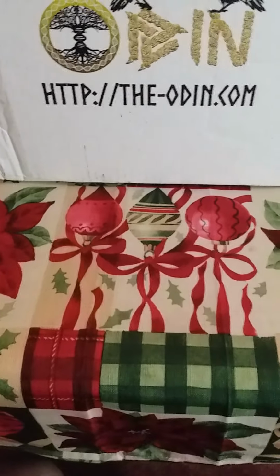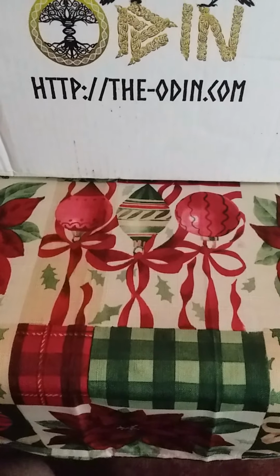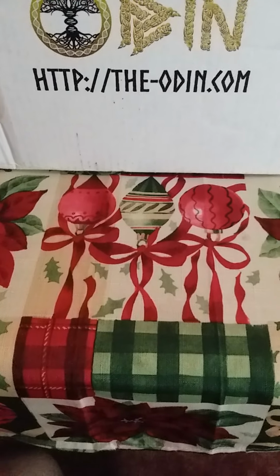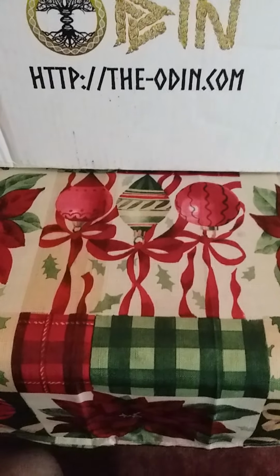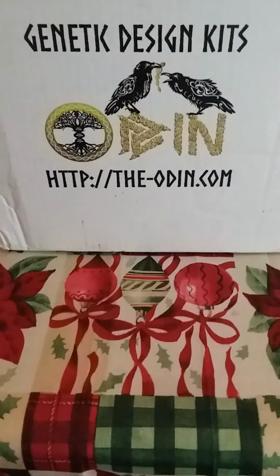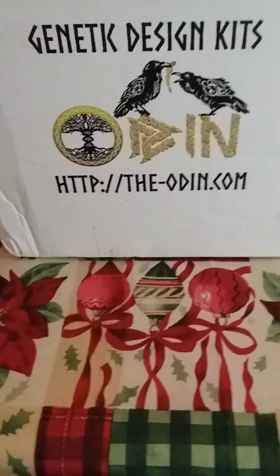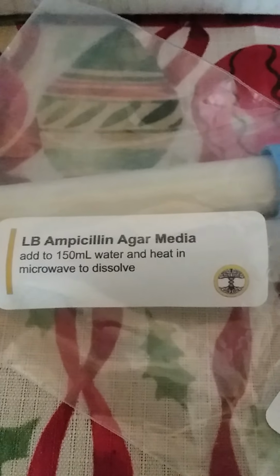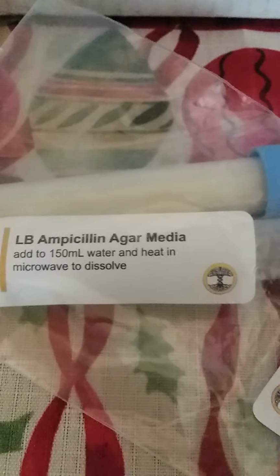Okay, so as it turns out the experiment was a failure, and this is due in a large part to the type of agar medium that I used. It was, well, here I'll show you. As you can see, it was the LB ampicillin agar media.